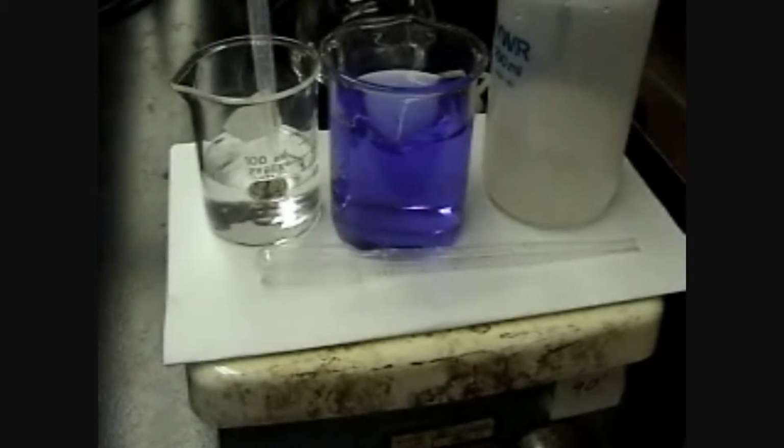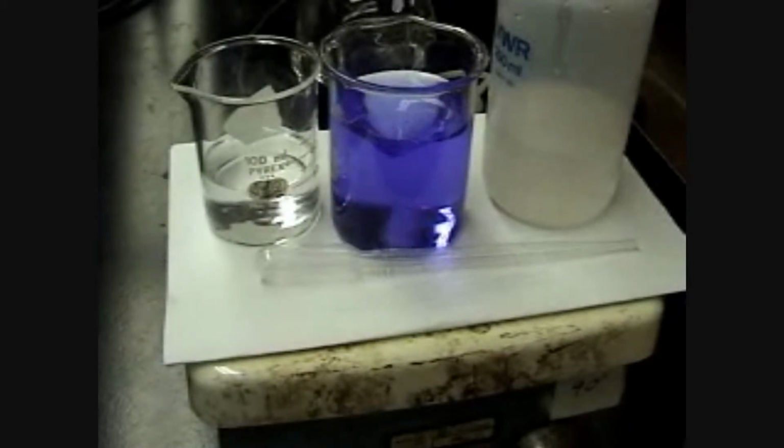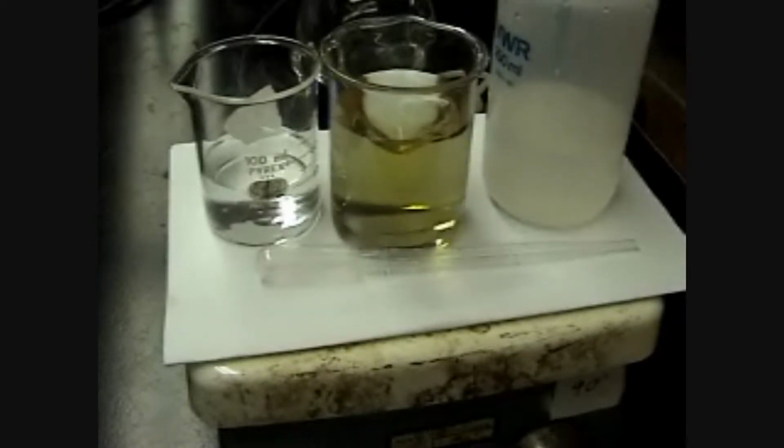And again, we'll go back and forth. We can go back and forth because all we're doing is taking an acid and a base, and we're going back and forth between the two compositions, whether it's acidic or basic. Now a base begins above 7 and an acid is below 7.